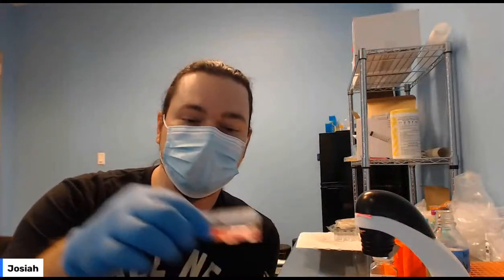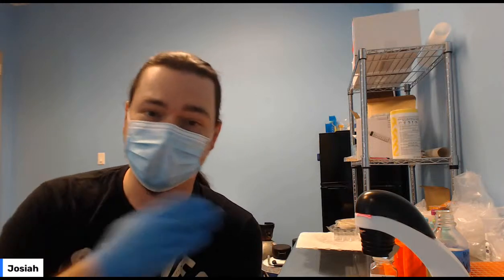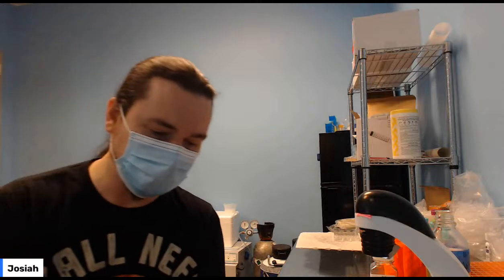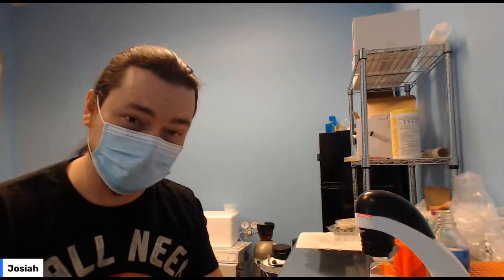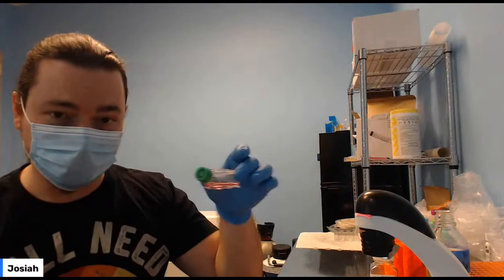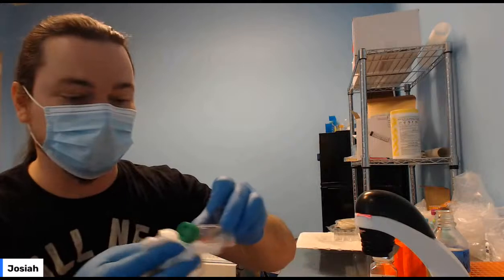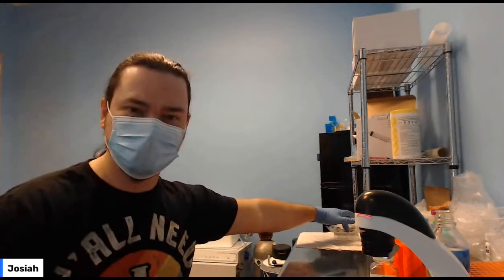Let's see. So if you don't have two flasks, just be really careful, because it's the kind of thing where if something goes wrong in the next experiment, everything gets contaminated. If you don't have a backup flask, you're out of stuff. So always make a backup flask if you want to keep everything going and give yourself plenty of flexibility. And then you should have a nice backup flask that you can use to keep your cultures going. You should have 4 of these 12-well plates, so you've got a few tries.